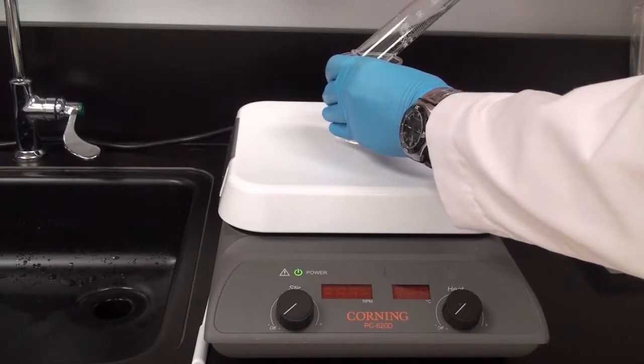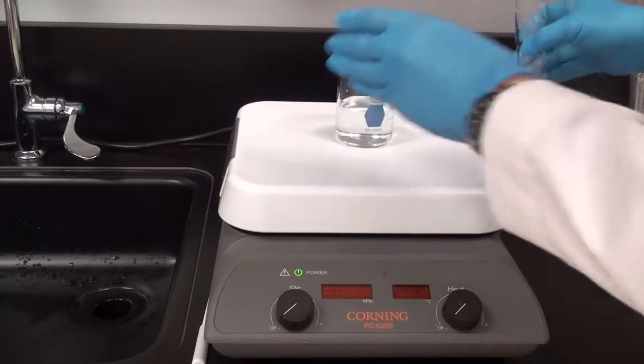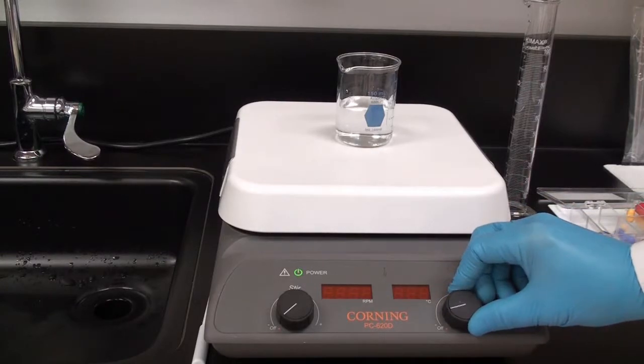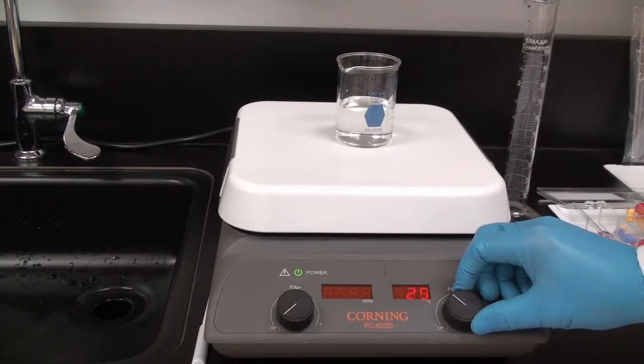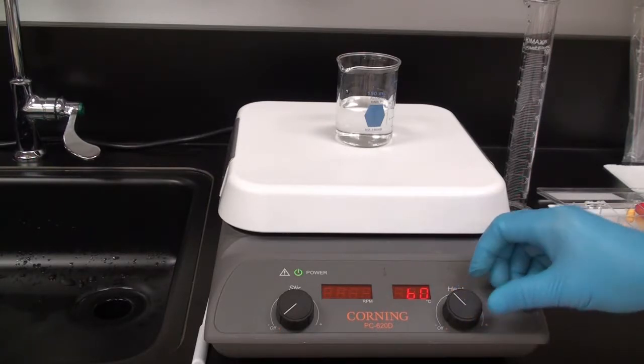Now if I were making a 1% solution, the volume of the solid would be negligible. But since I'm making a 16% solution, I want to make sure that I don't overfill and make more than my 100 milliliters to get 16%.